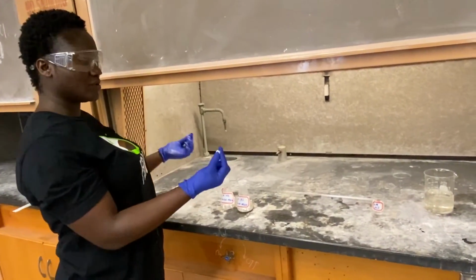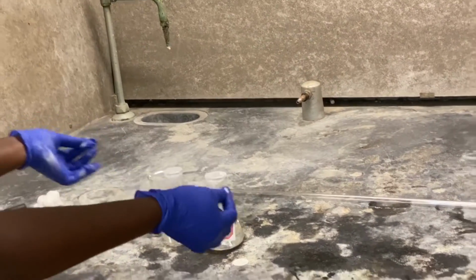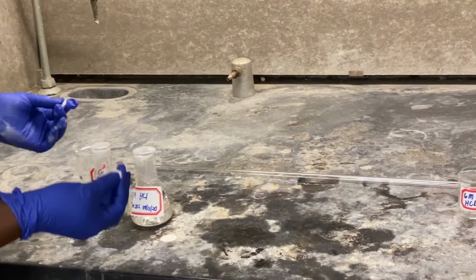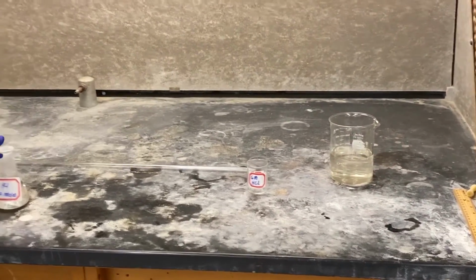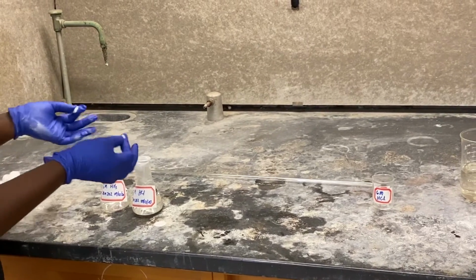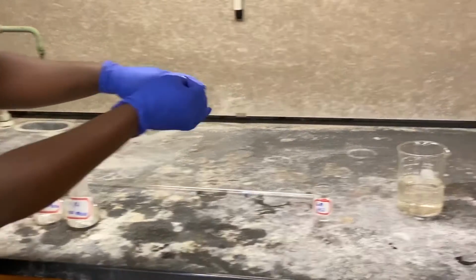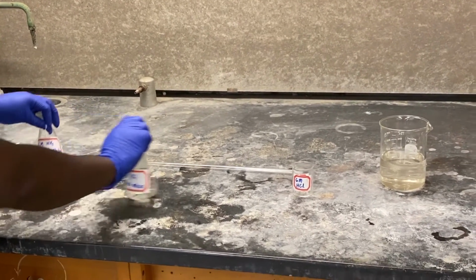We have the wool, so I've cut out a piece of them. I'm going to soak this wool into the two different reagents, and after we are all done, I'm going to just dump those ones because these chemicals are actually corrosive, so you don't want to play with any of them. So I'm going to dump the wool inside the water so that there is no form of exposure to chemicals.